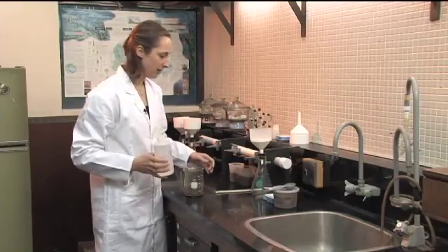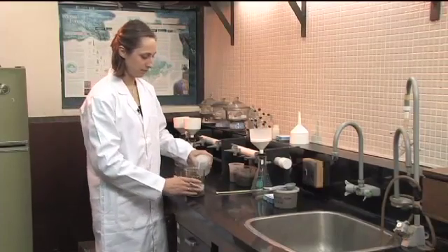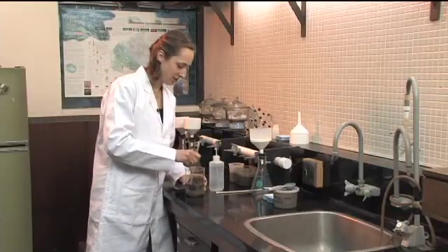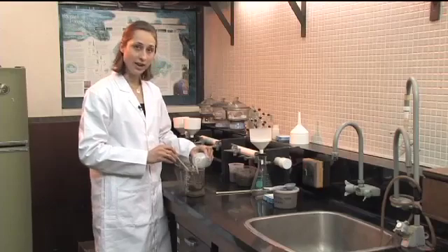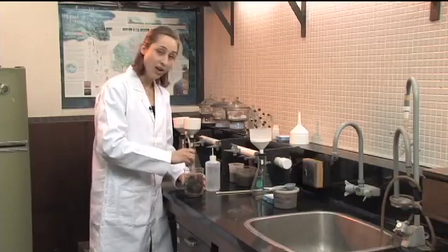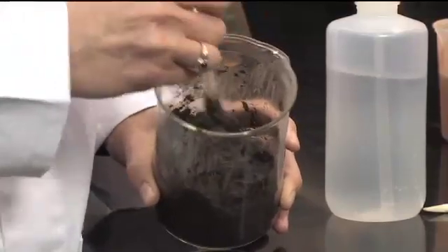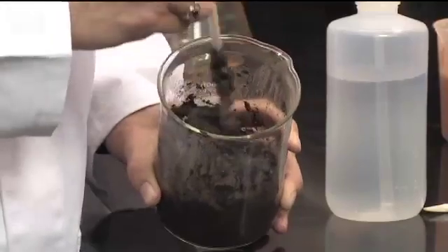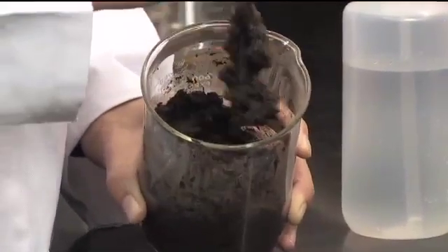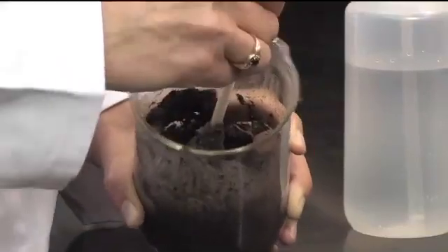You want to take your distilled water and a little spatula and start wetting the soil down the side. You don't want to completely drench the soil, but just make sure it's starting to get wet. What you're aiming for is a saturated paste so there's no extra water standing on the surface but the entire soil is wet. It's a bit of a subjective process, but you can also do a specific ratio — one to two soil to water — though the saturated paste is more standardized and more common. You always have to specify the soil-to-water ratio you used with your result.